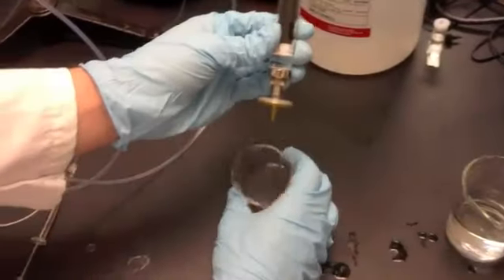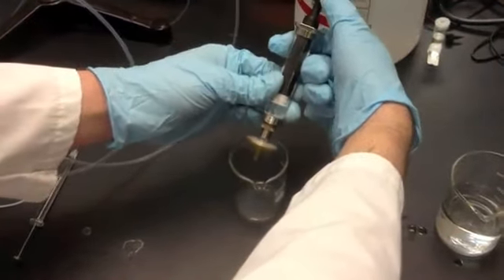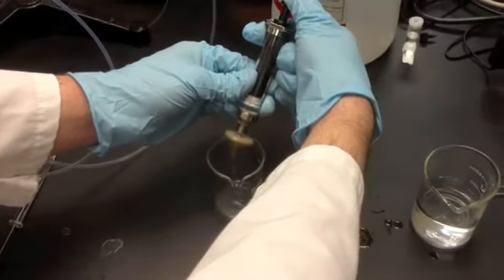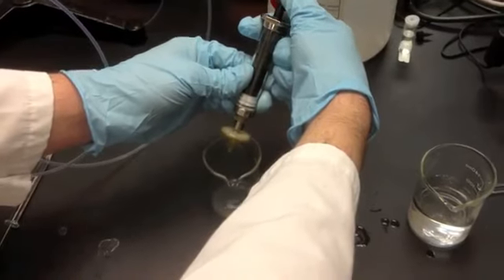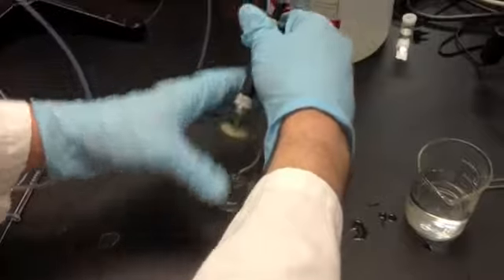Now into an empty beaker, we're going to put our filtered sample. Just press, and the filter will fill up, and our product will fall into the beaker. There we go. You don't need much.